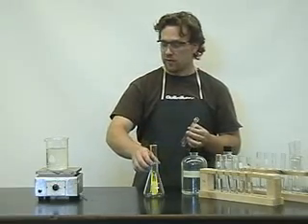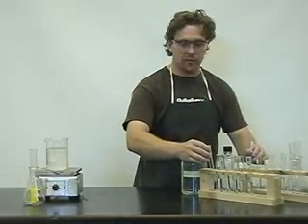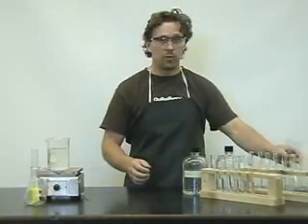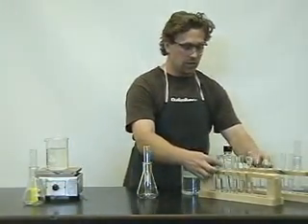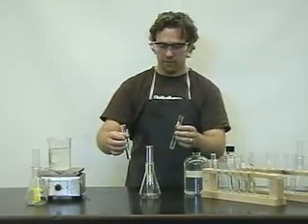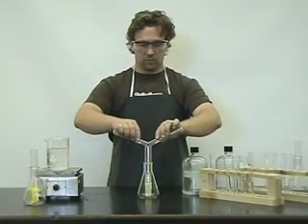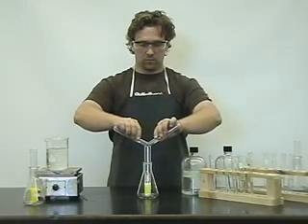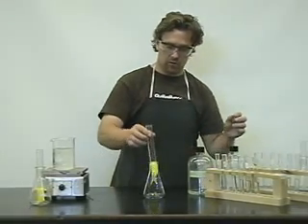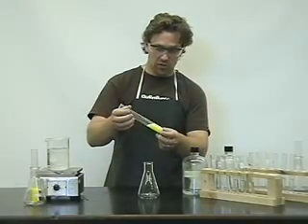A precipitate did form in the first set. The next two solutions are more diluted. We also see a reaction — we notice the yellow color, and there is also a precipitate formed in this second set.